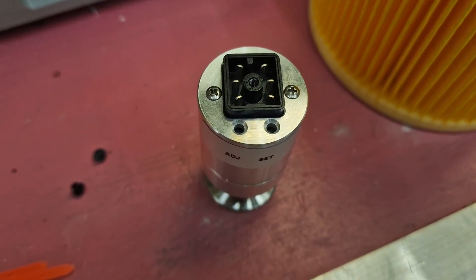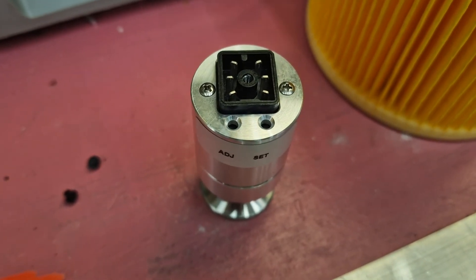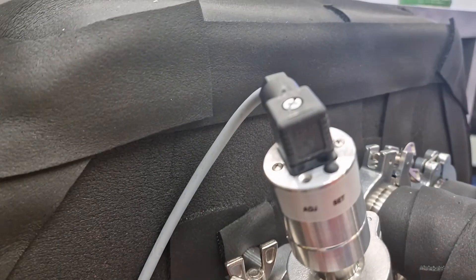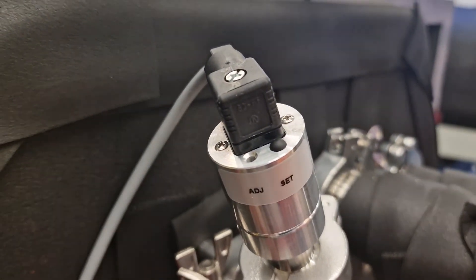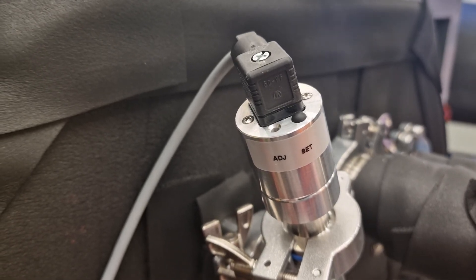But over time it's very difficult to protect the sensor for many years so it will have to be replaced at some point. After reinstalling the sensor make sure you restart the machine otherwise it will not have a correct reading.